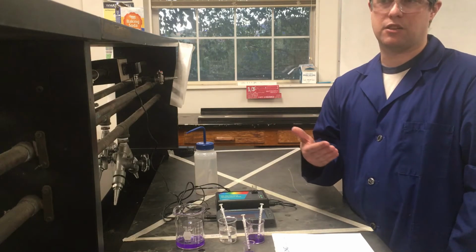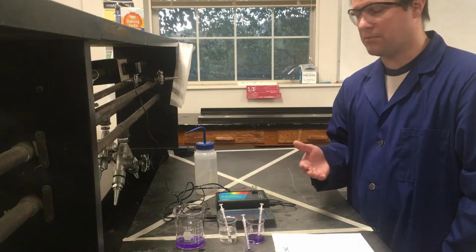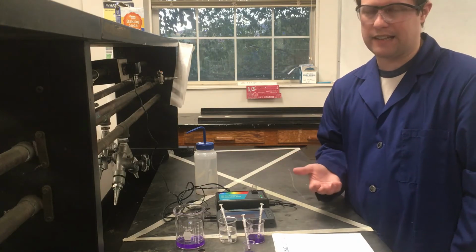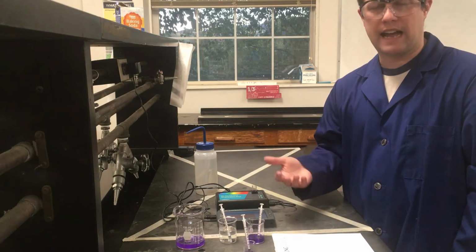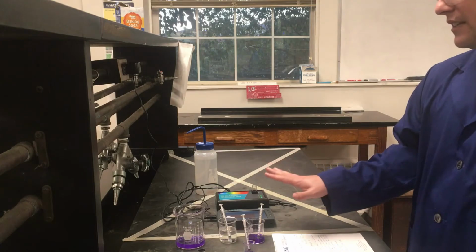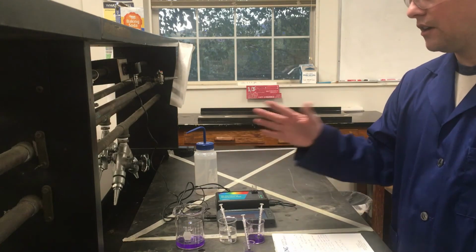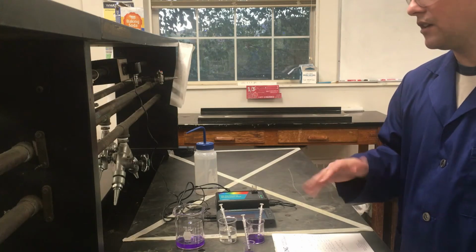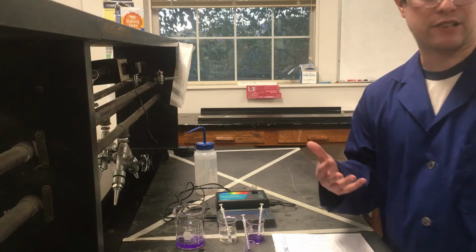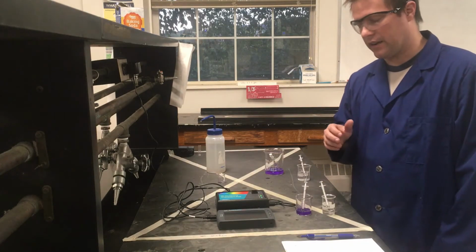And that will be the preface to our kinetics lab, lab 5, which is going to be that same crystal violet sodium hydroxide reaction, investigating the kinetics of that reaction to see what the reaction orders are for our different reactants and things of that nature. So, like I said, rather than show you the painstaking measurements, I'll summarize all of that towards the end. I'm going to jump to the third part of the experiment next, where I'm actually going to set up that reaction.